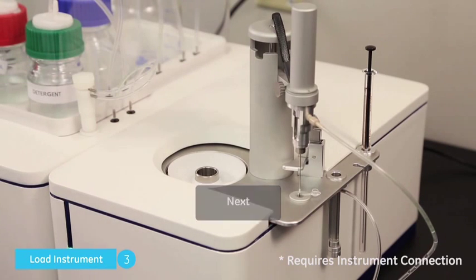Click Next. The instrument is now loading the syringe with the titrant material.